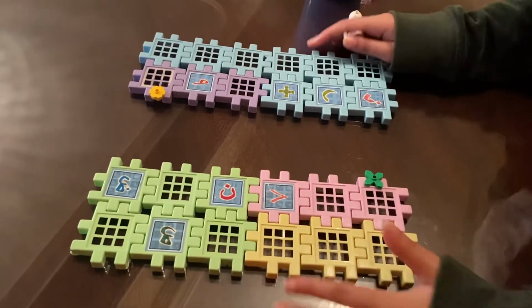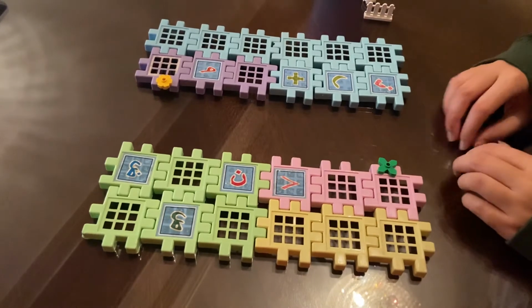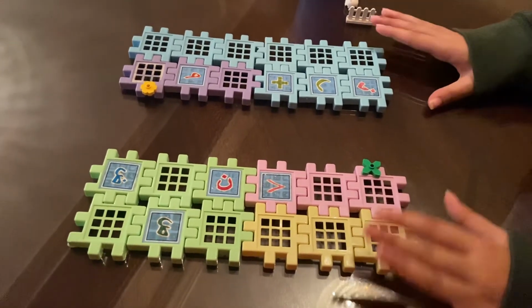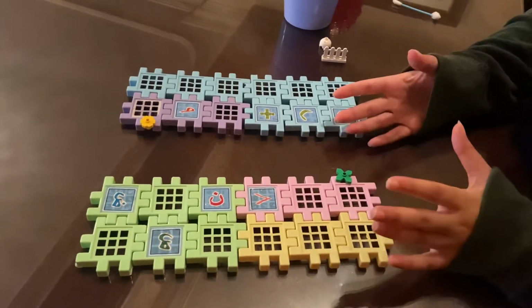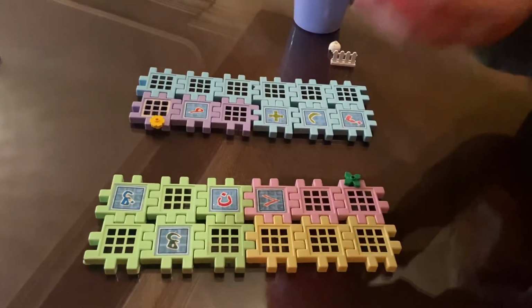So then PCR is repeated many times, and each time the amount of DNA exponentially increases until there is enough DNA to be analyzed. So if the virus is present, the probes send a signal, meaning the test is positive, and it means the patient has COVID-19.